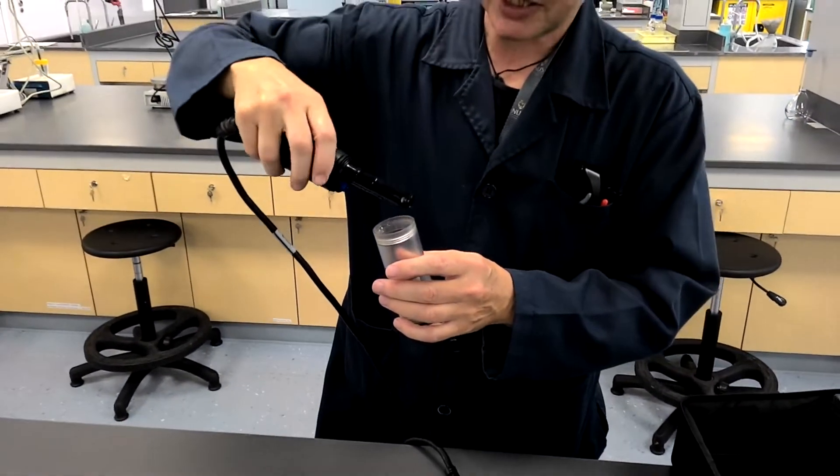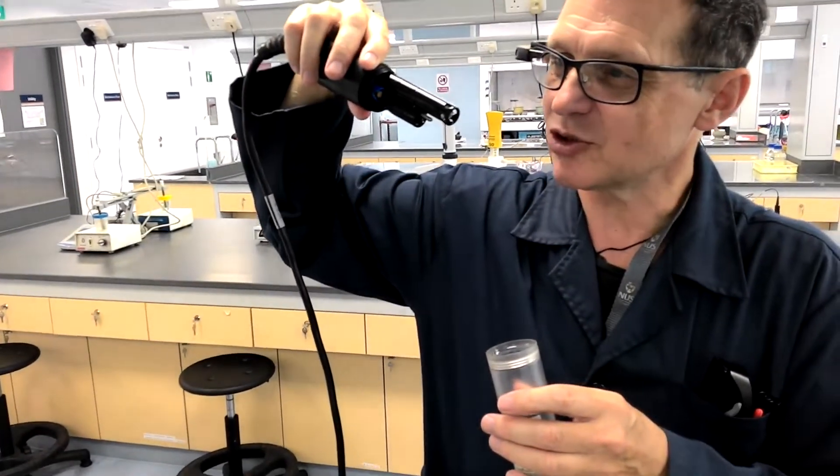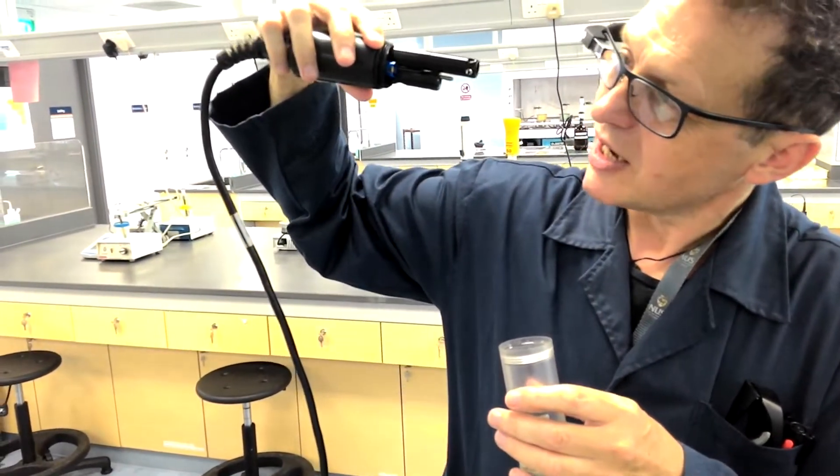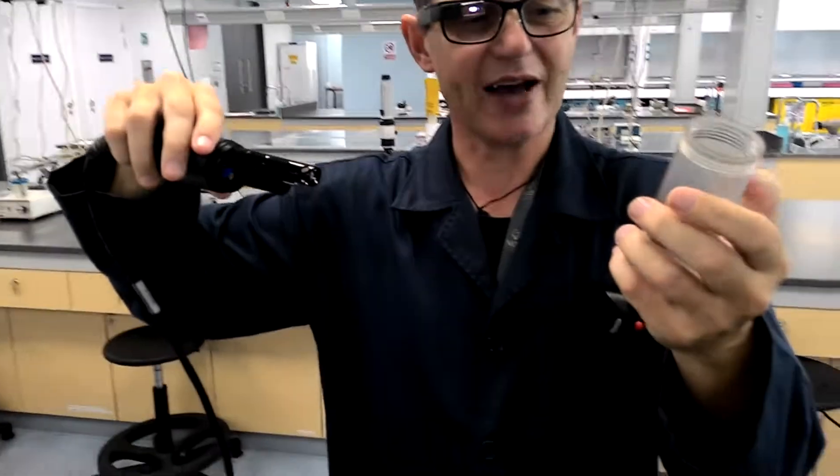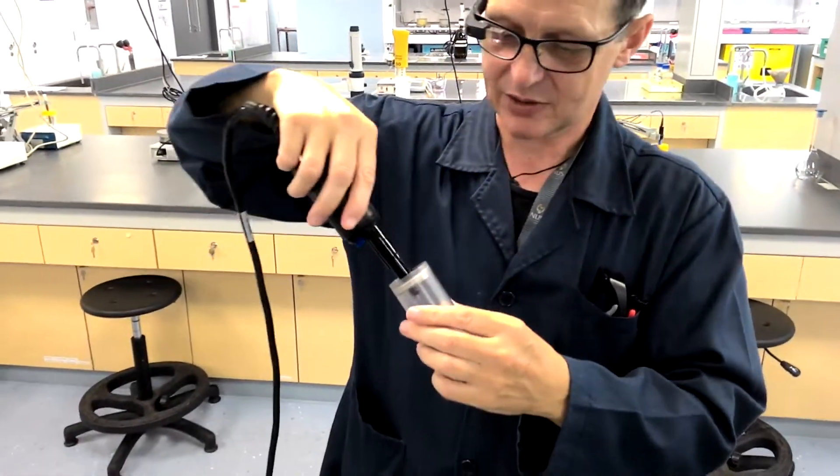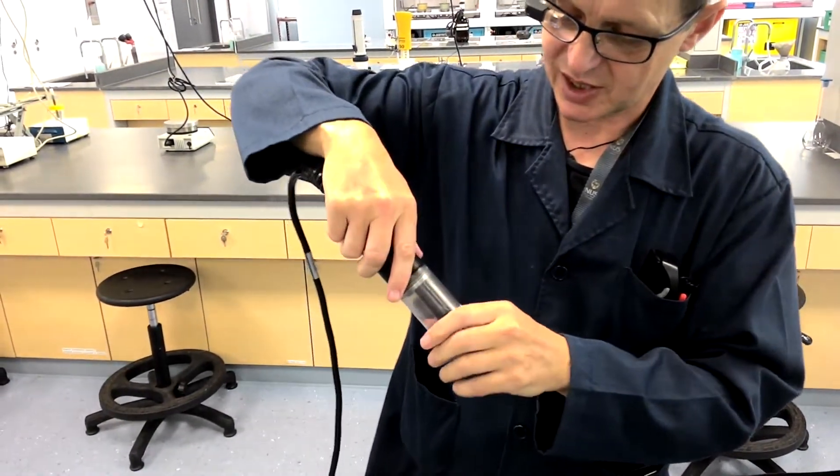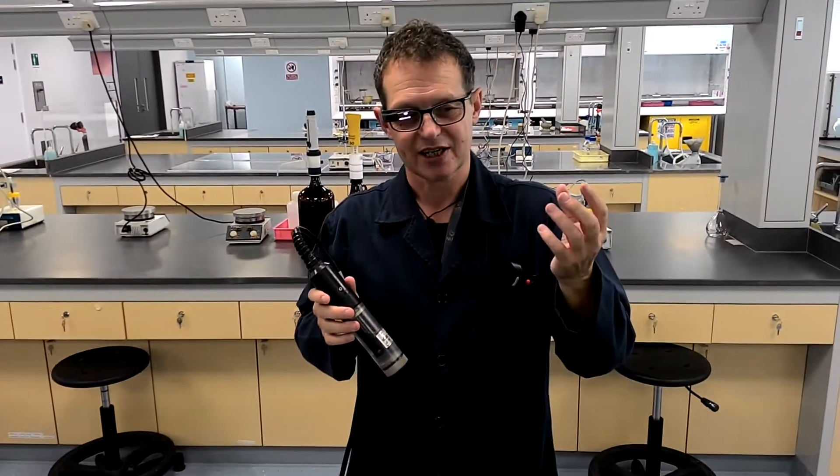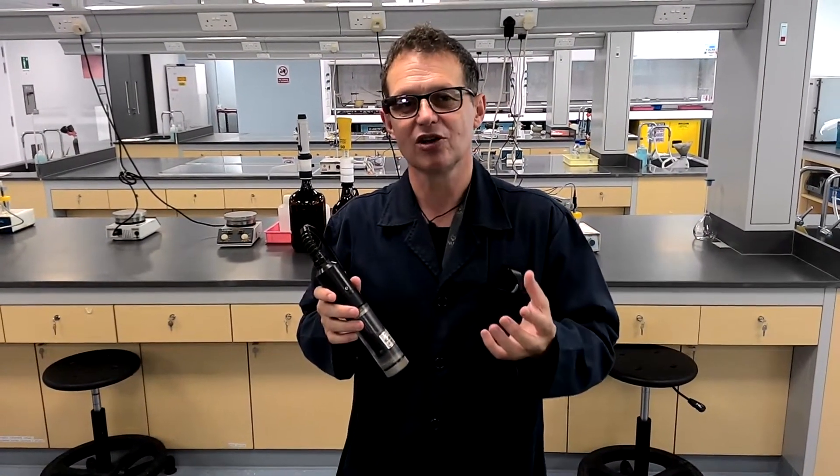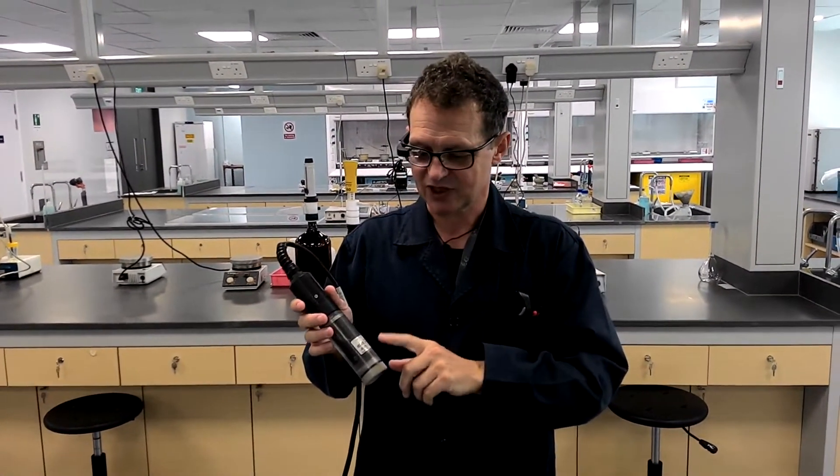OK, you're actually completely correct. I'll look at this. I'm wearing a Google Glass. So basically you should see what I'm seeing. And you can actually see that that is a pH probe. That is why you have liquid here. Now, yes, you can store pH probes in water. But to do so, this is boring chemistry. It's good short term. It's not good long term because the electrolyte then diffuses out the electrode. So this will be a saline or a buffer solution.